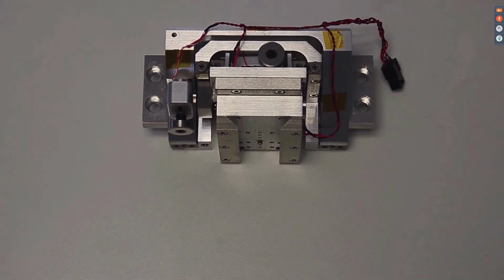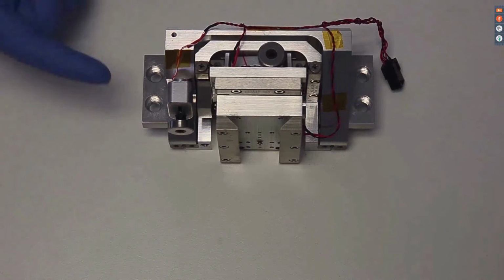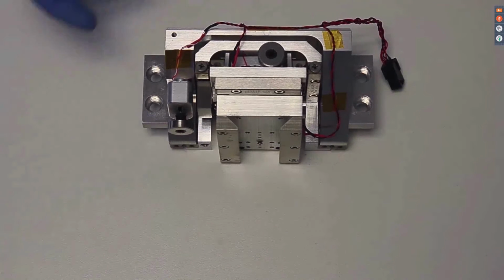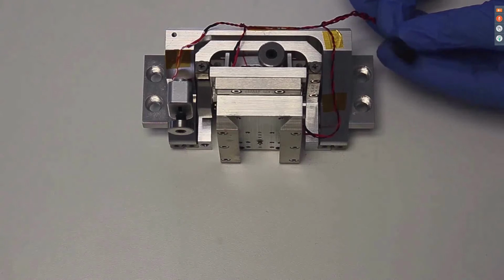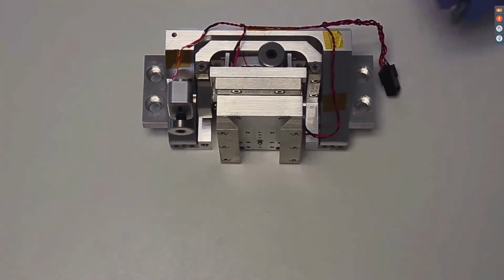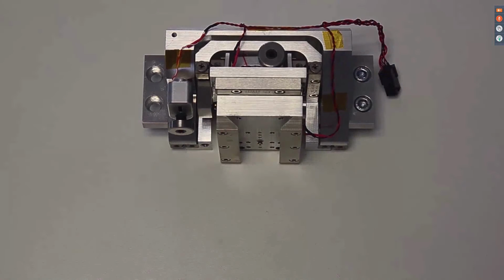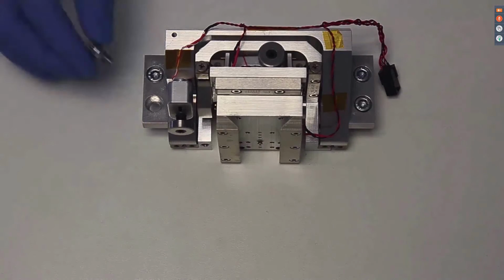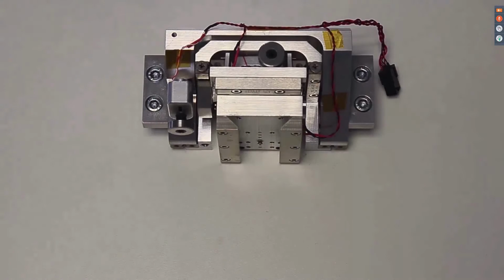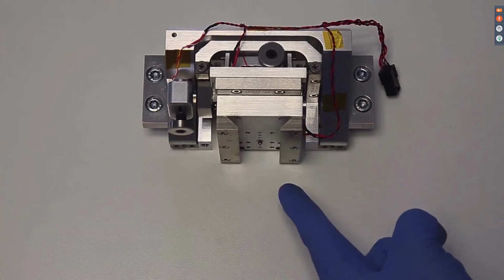In the second part of the video, you will see how to mount the stage and the AFSEM scanner. The stage with its motors for 3D positioning can be mounted to the mechanical adapter in the SEM using only 4 screws. This allows for a quick and easy installation in almost any SEM.